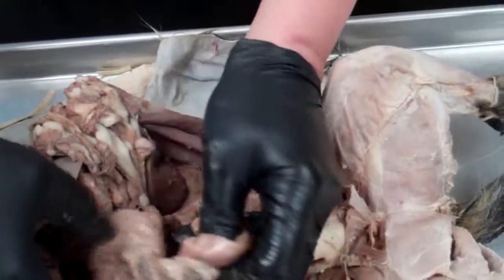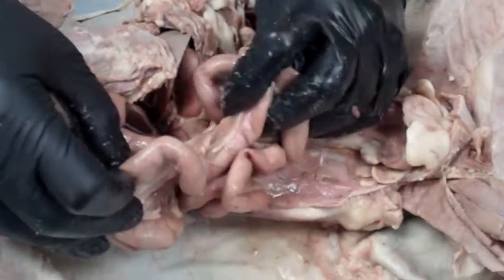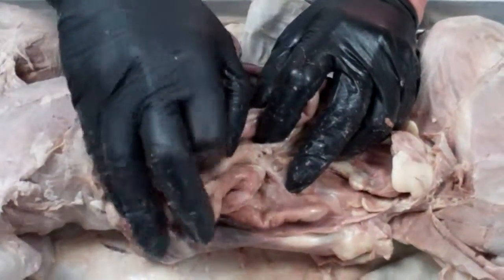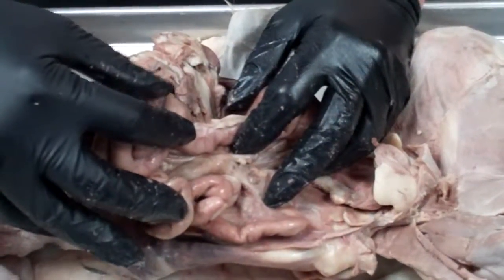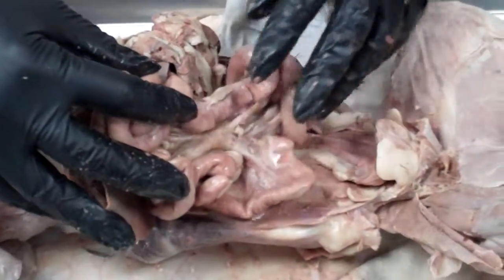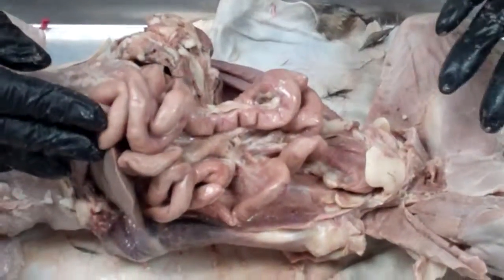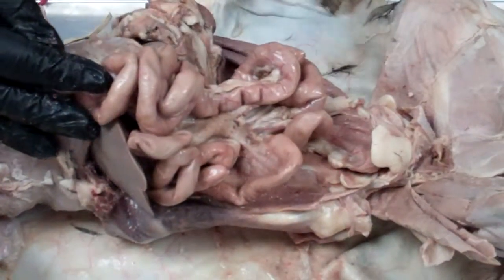They tangle around a bit, and when I think I have made it about halfway, then I have the jejunum, and the other part that I didn't collect, that's just lying up here, this is the last part of the small intestine called the ileum. So we have the duodenum, the jejunum, and the ileum. Those are the parts of the small intestine: duodenum, jejunum, ileum.